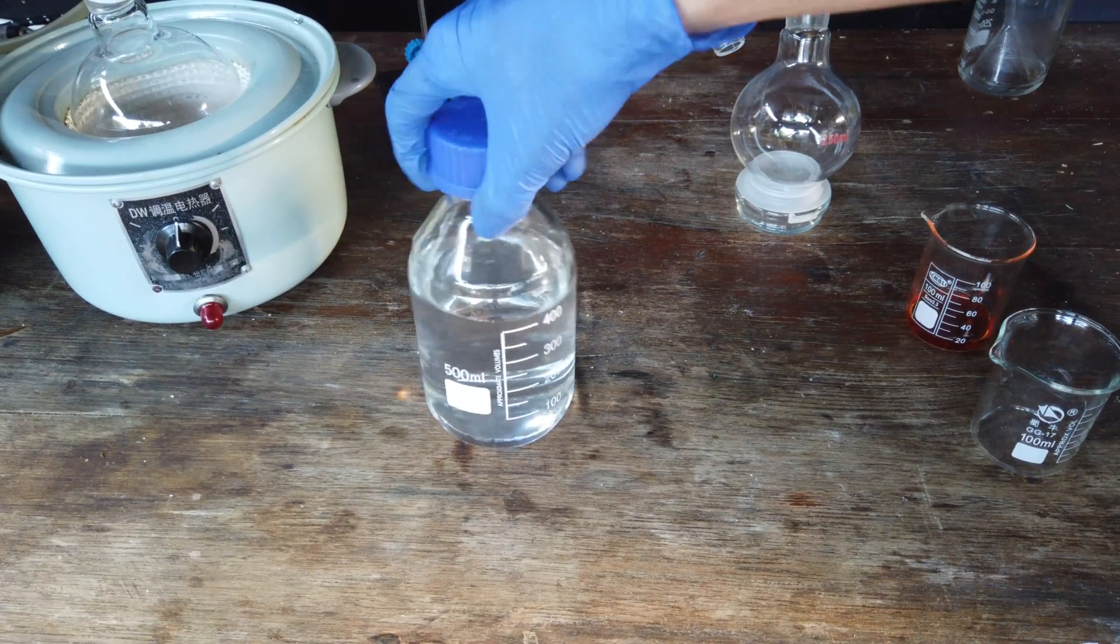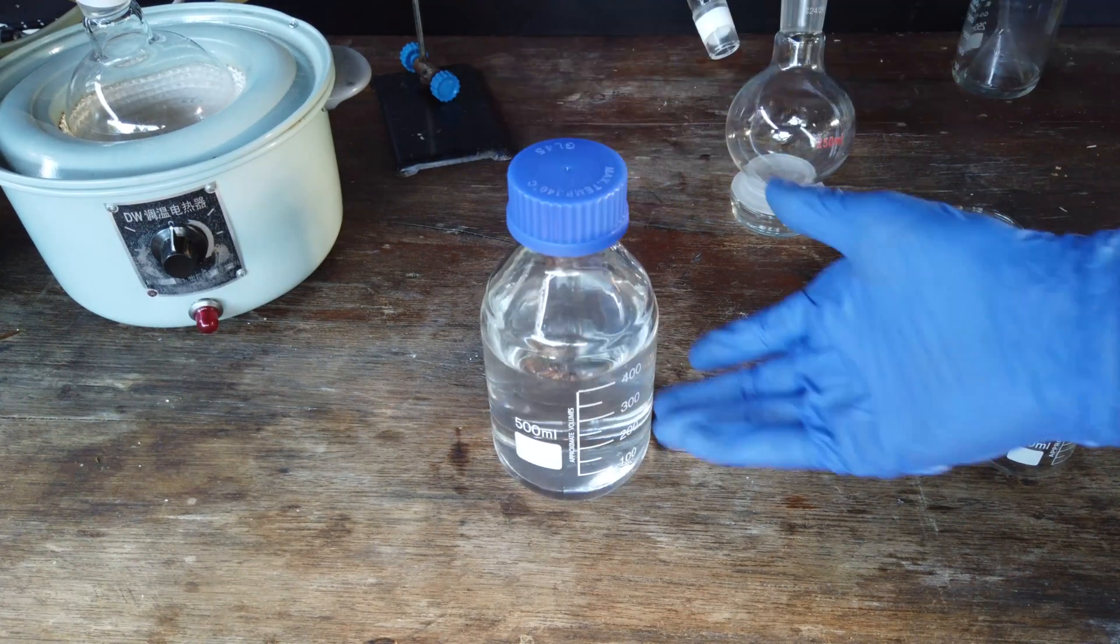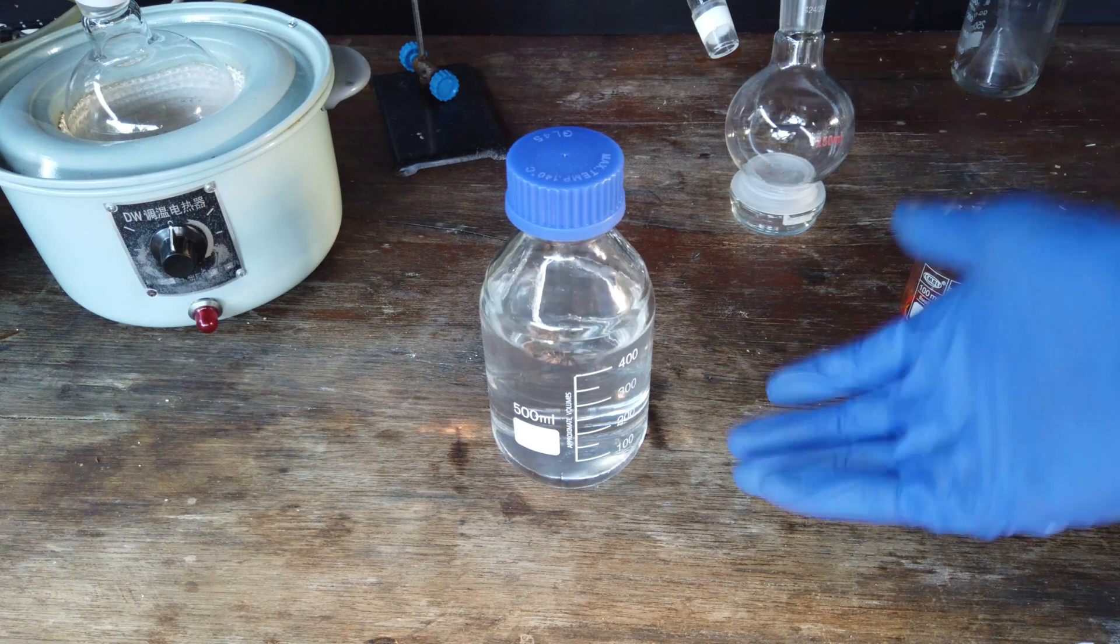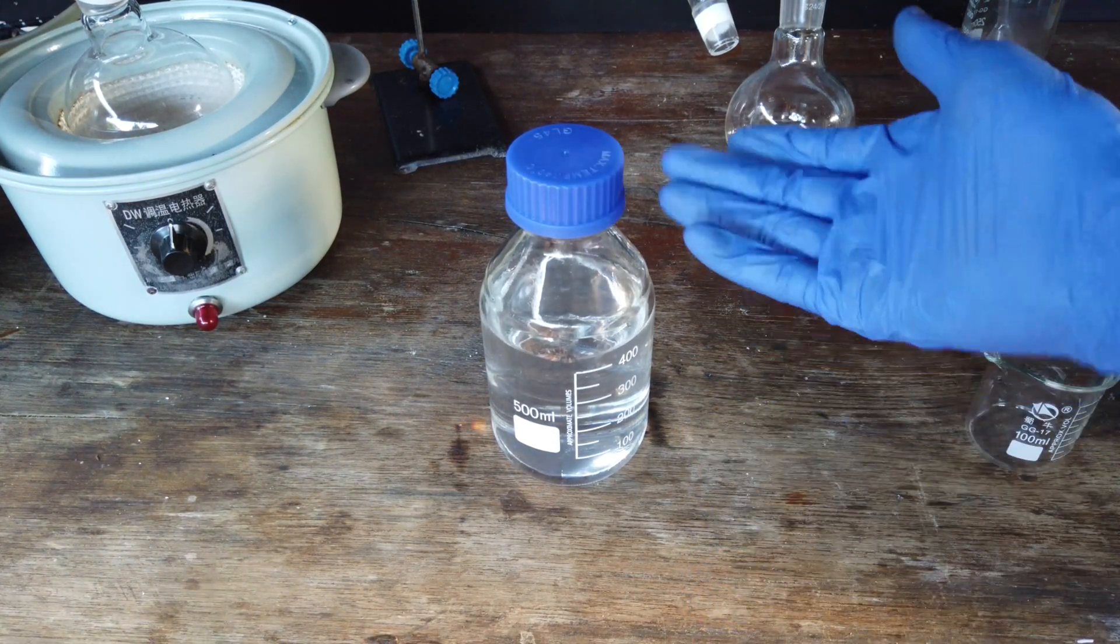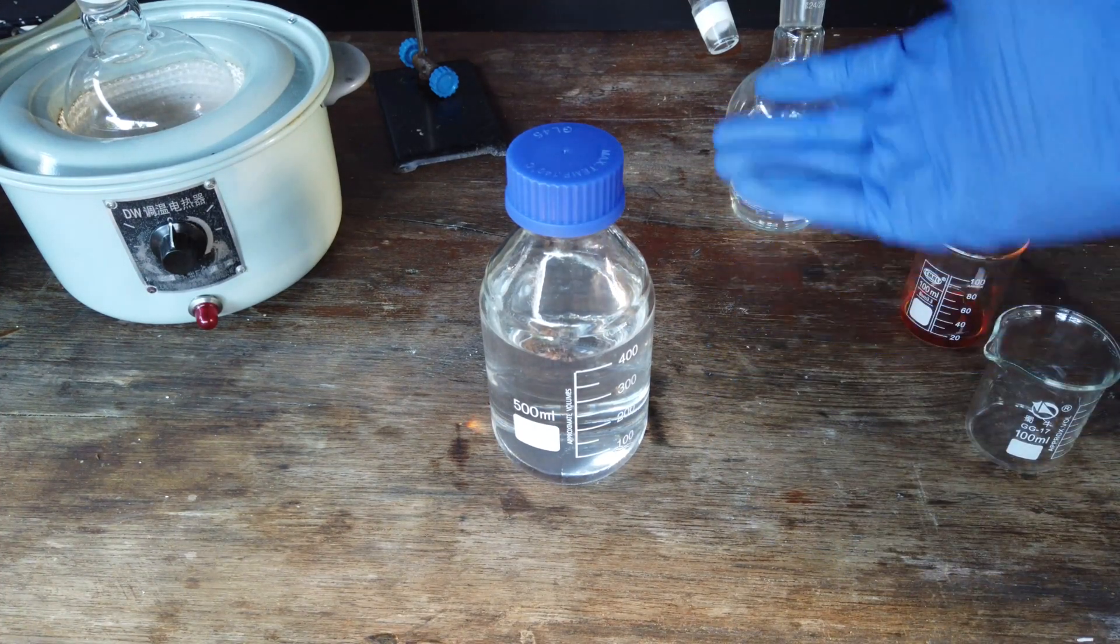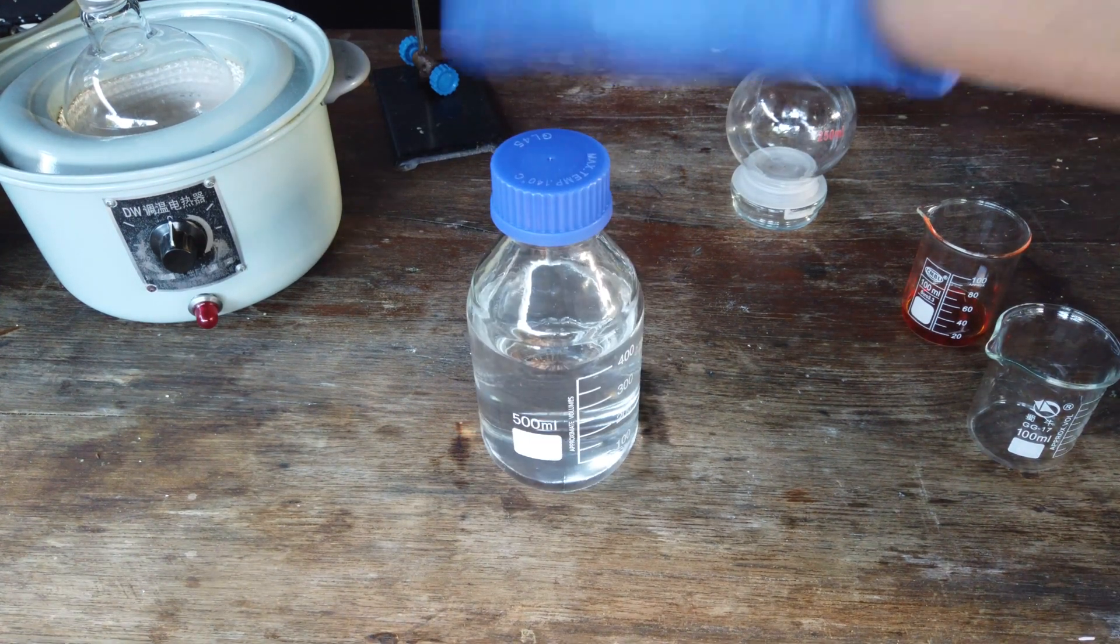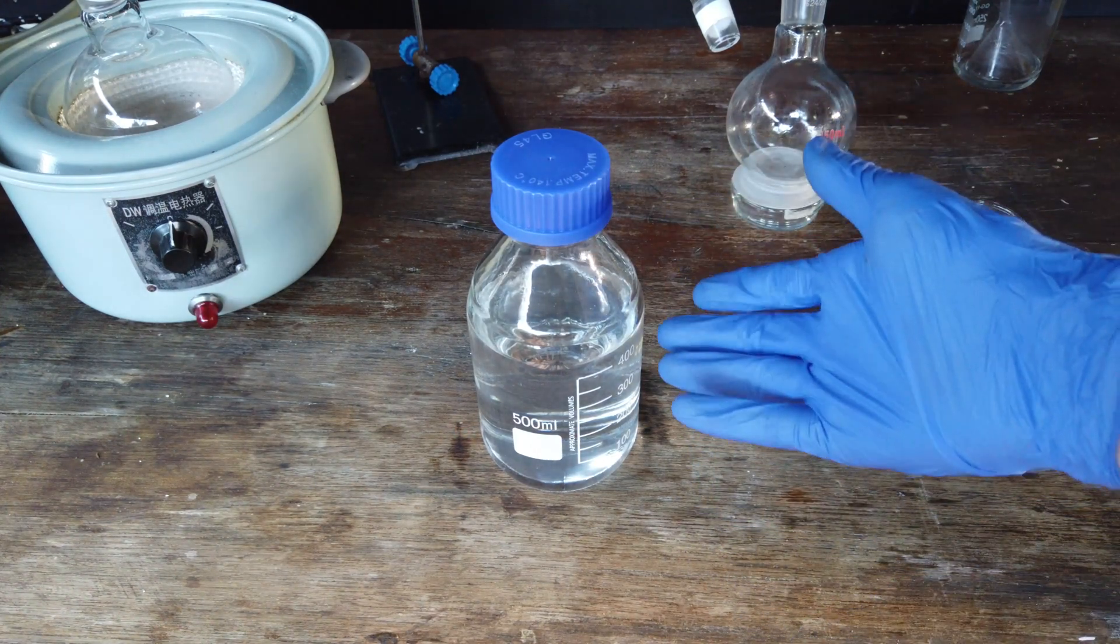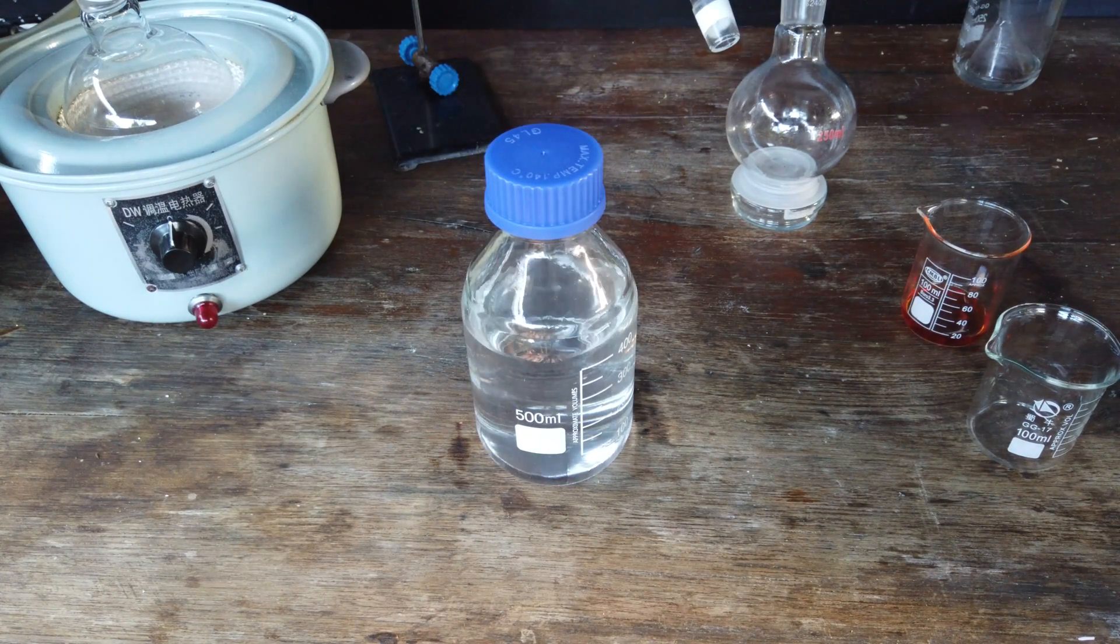As a final note on storage, I mean I am storing our purified acid now in this glass chemical bottle, because it looks nice. It's very much overkill though. I mean, quite a few plastic bottles will hold concentrated hydrochloric acid just fine. I mean, it comes in a plastic bottle from the hardware store, so it'll do perfectly fine. But anyway, there we have it. 500 milliliters roundabout of crystal clear hydrochloric acid purified from the stuff we get at the hardware store.